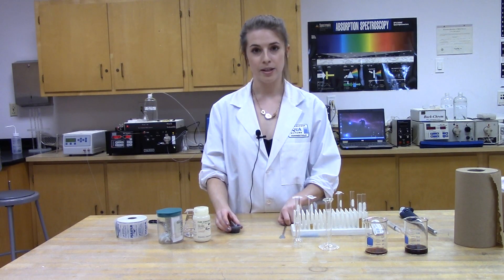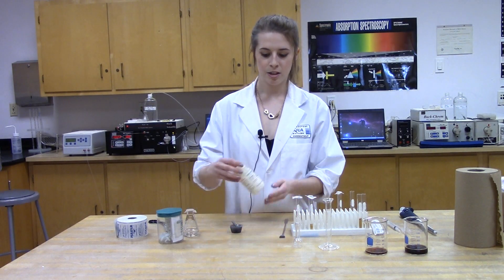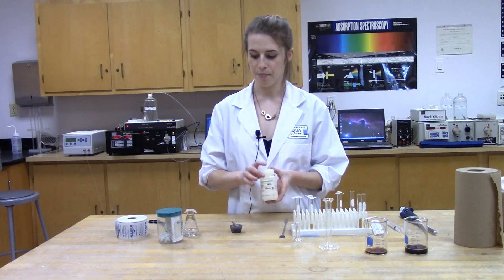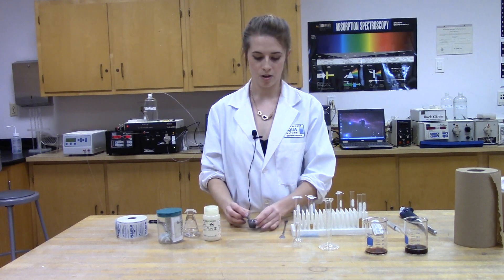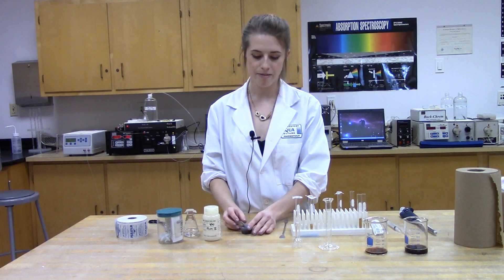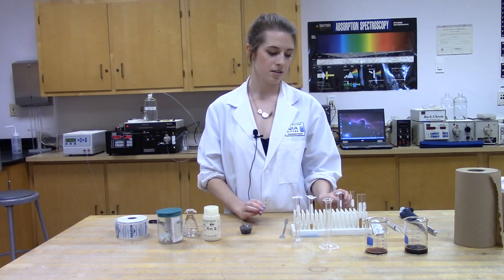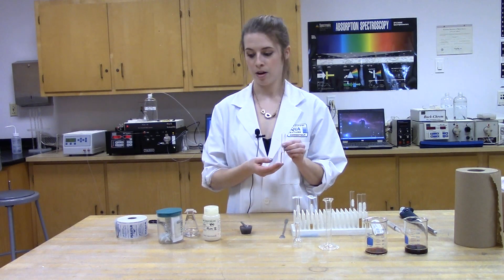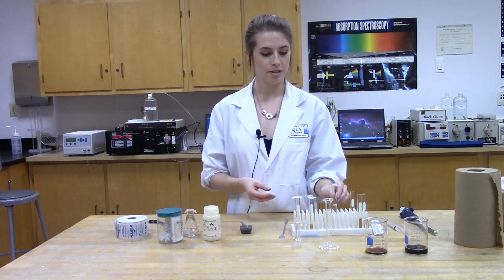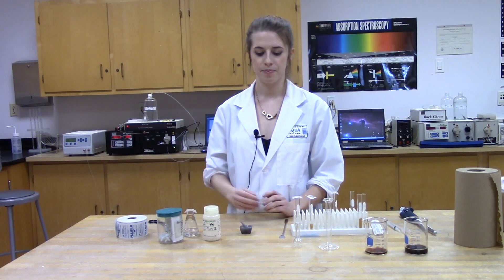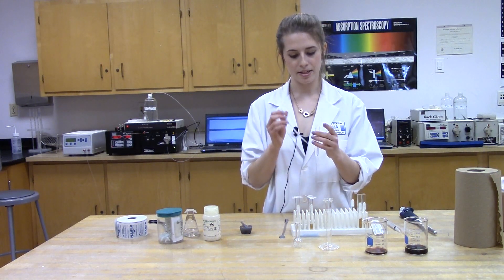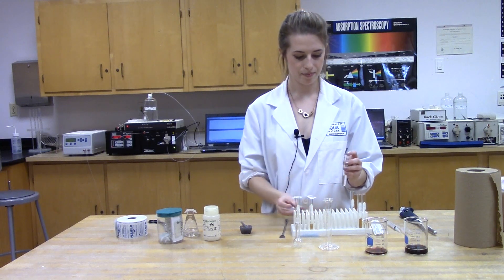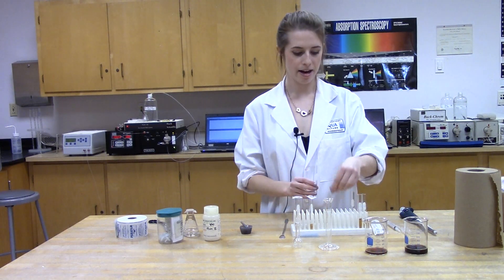In order to identify that there is indeed caffeine in the coffee, we need to run a pure sample of caffeine. To use this, we have a pure sample of caffeine right here. I took a small amount of this, put it in my mortar and pestle, grinded it up so that it will dissolve faster.